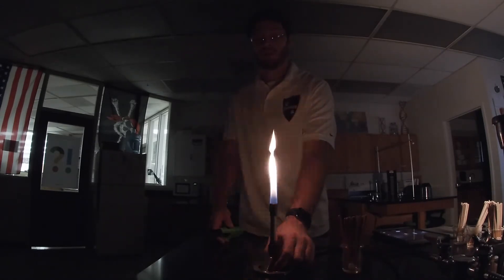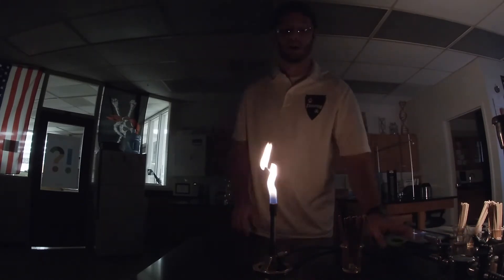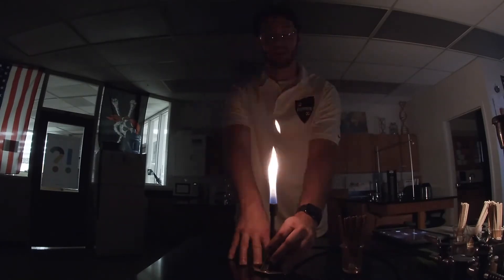To get started, turn on your burner. I'm opening the bottom valve of my Bunsen burner and lighting it. I want to make the flame approximately seven to eight inches — a non-luminous flame with no orange. I'll change the mixing ratio between gas and air by opening the chimney, getting a nice blue flame. I want a nice inner blue cone, and if I listen carefully I can hear a crackling noise. I'll place my wooden splint right at the tip of that inner blue cone, which is the hottest part of the flame.